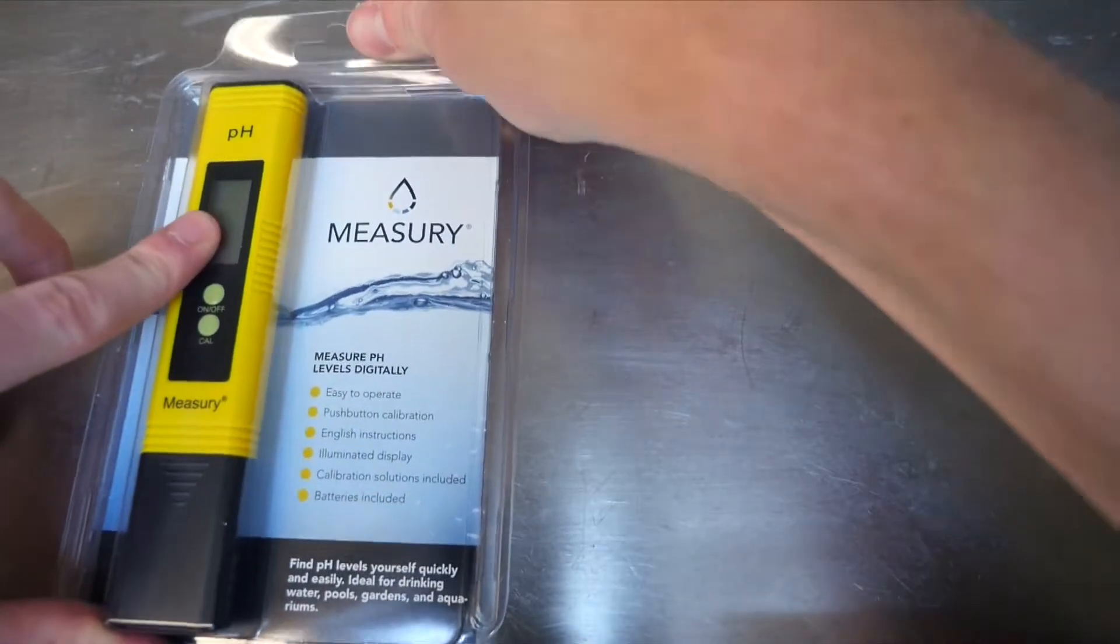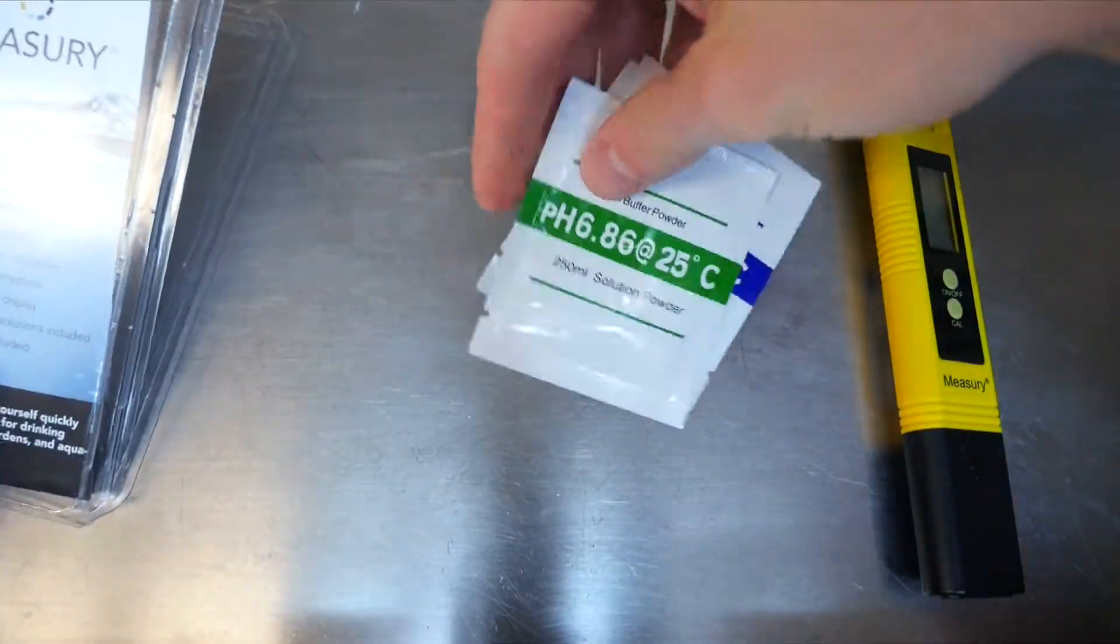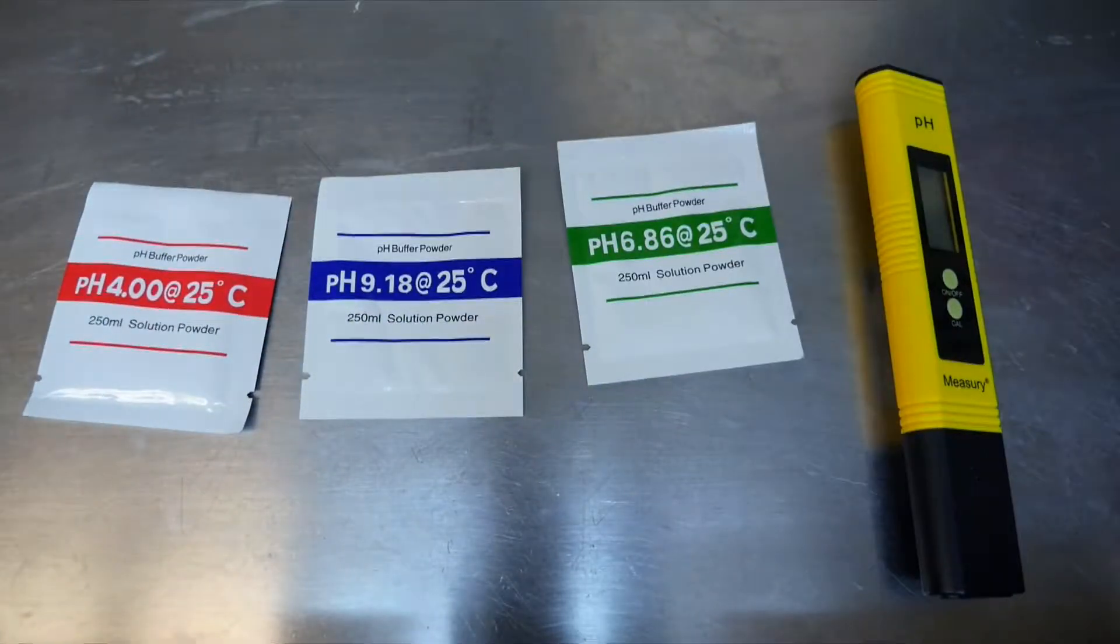In order to achieve the best results, you should calibrate the device before its first usage. This can easily be done in five minutes using its buttons and the provided calibration solutions instead of a screwdriver required by other devices.